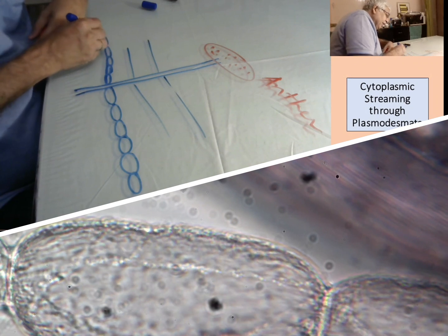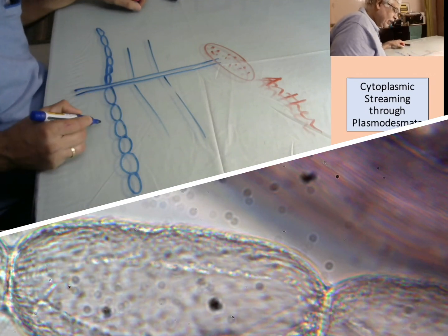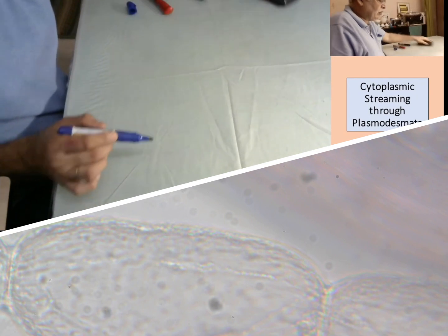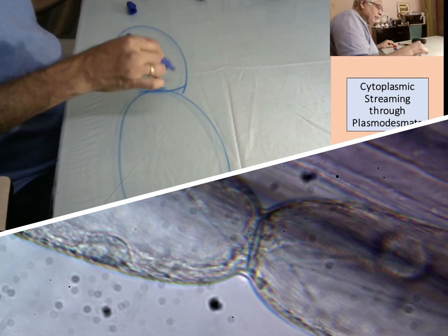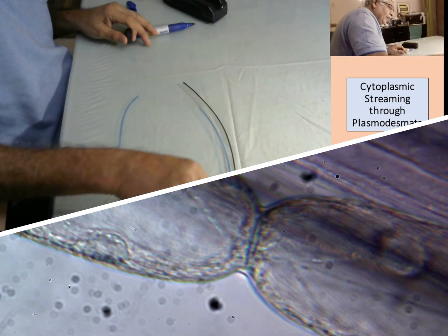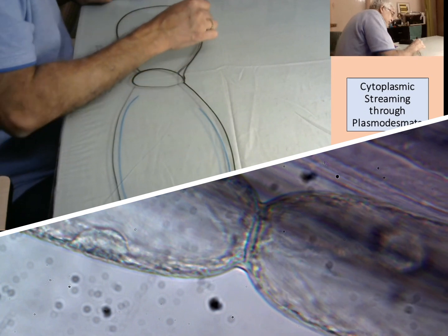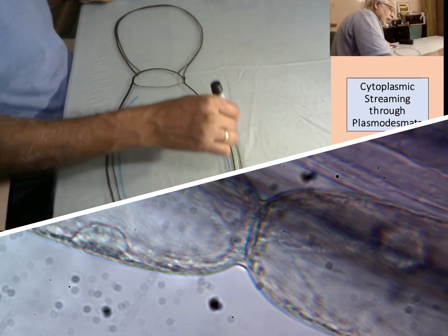We call these serially formed cells — just like train compartments, the cells are attached. When we see this at 10x we see this view. When we see at 100x the view changes, and at 450x the view changes absolutely into big cells. The cells are attached with some connection. This black one is the cell wall, and we find this cell wall connects with another cell wall in a roundish fashion — it is actually a 3D view where one cell is attaching with the second one.